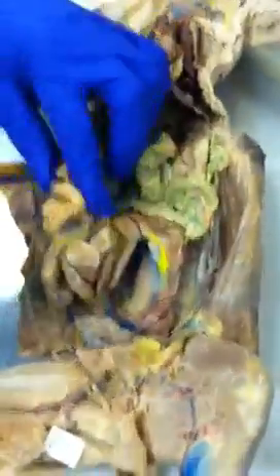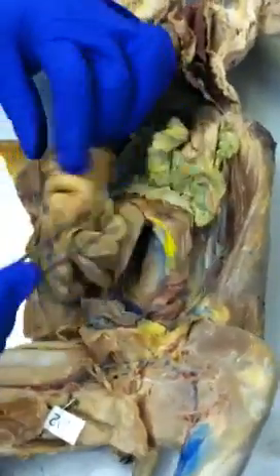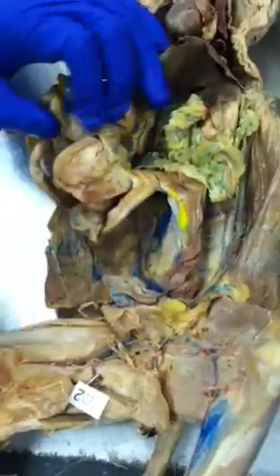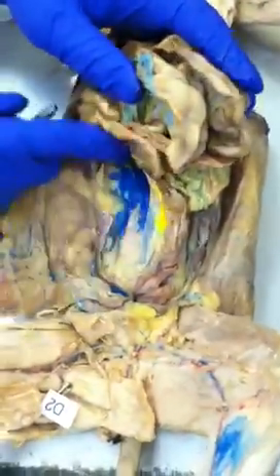Don't say small intestine, because that will be half of it. Okay. Say duodenum, and if the pin is here, that will be jejunum. The ileum, like I said, is the longer one, but you're not going to see the demarcation between the jejunum and the ileum. So what you would have to do is follow the small intestine, follow it, and then follow it some more, I guess.